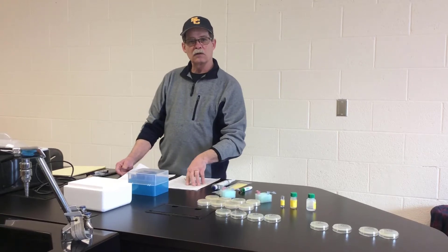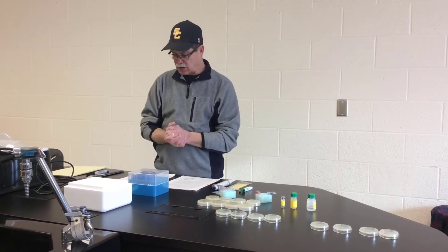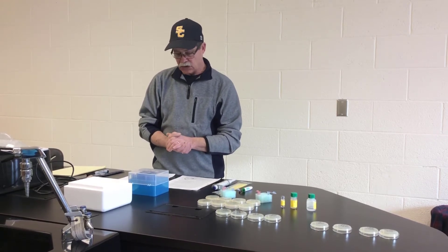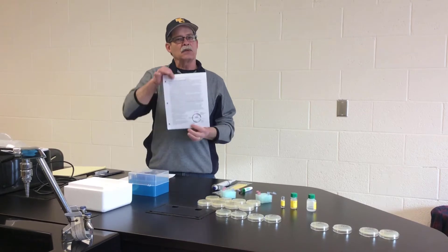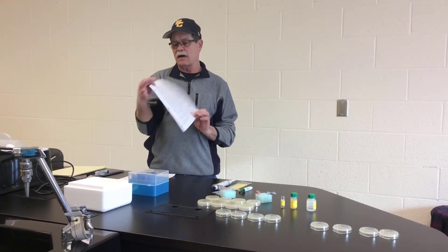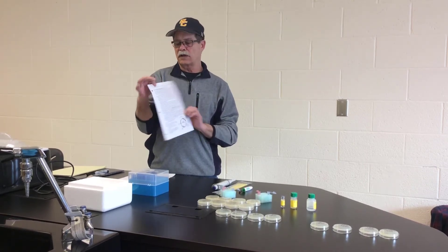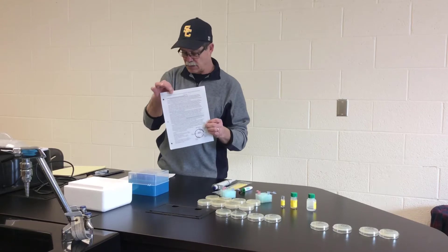Hello everybody and welcome to Microbiology Lab today. We're going to talk a little bit about bacterial transformation. I want to remind everybody to please read their lab handout, Lab 9, Transformation of pGLO Plasmid.